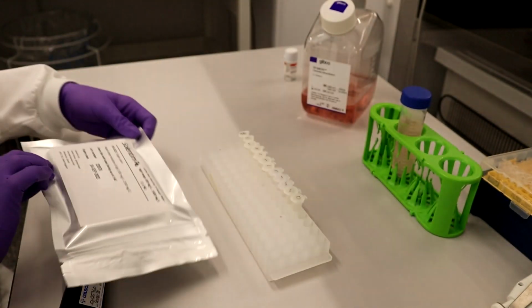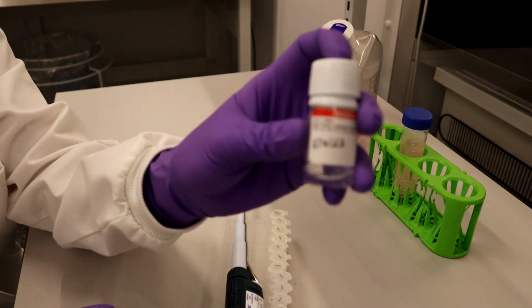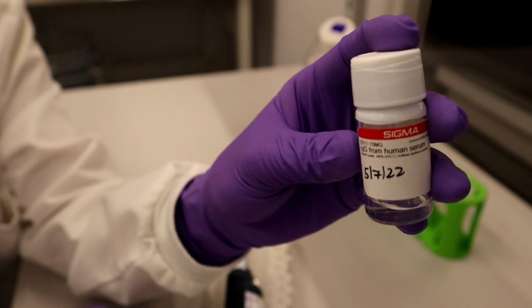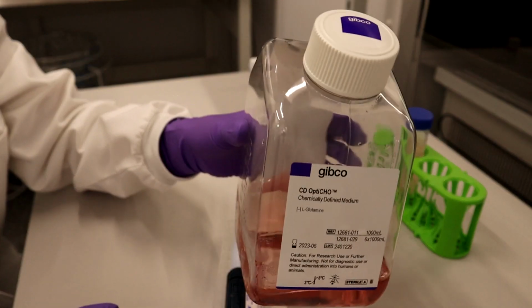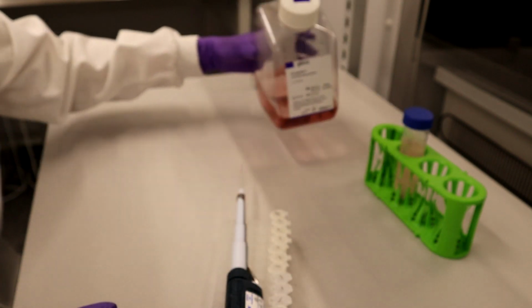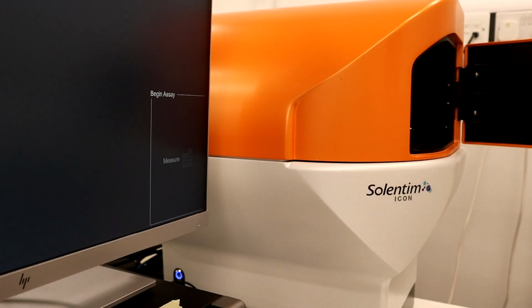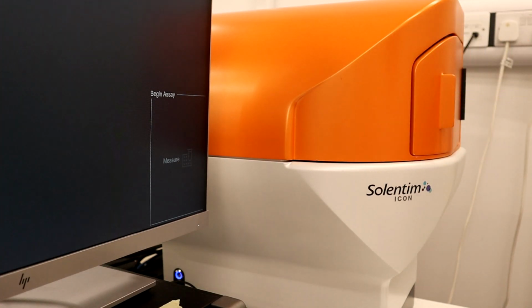Your standard curve should be generated using an IgG molecule, which is characteristically similar to what your clones are expressing. Secondly, it is important that your IgG molecule is diluted in the same medium that your clones have been cultured in. As iCON's productivity assay is based on fluorescence polarization, it is important that the medium that your clones have been cultured in is free from fluorophores, such as phenol red.